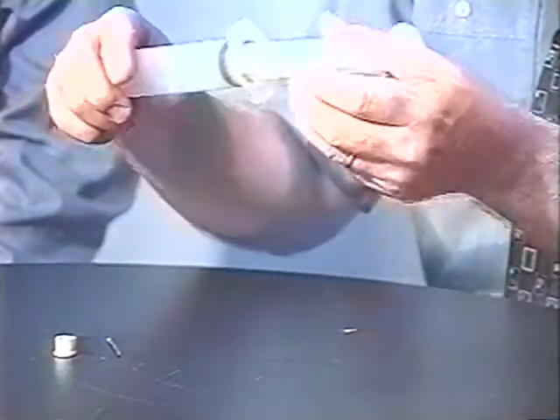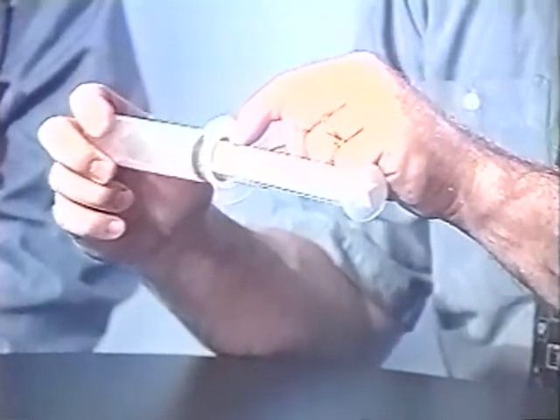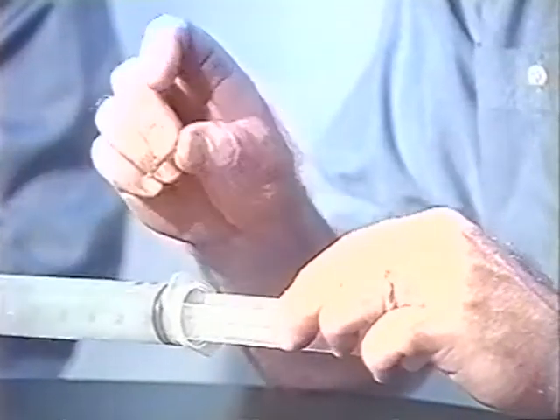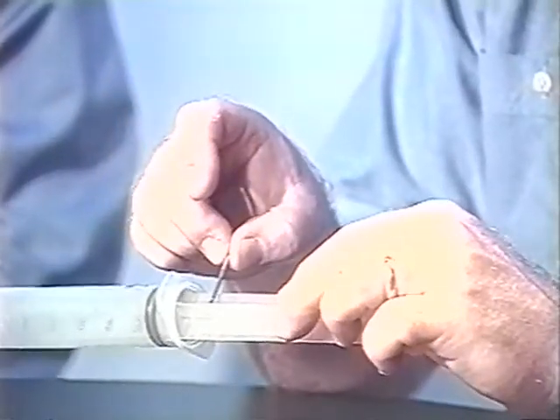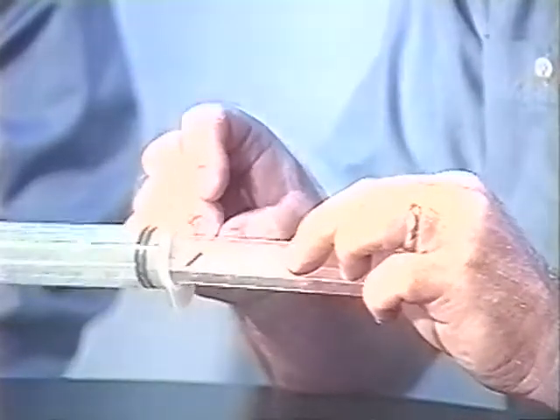Large syringes can also be used to determine the molar mass of gases generated. In order to do that, we have specially adapted a syringe by boring a small hole through the plunger. This was done by heating a nail in a flame until it was pretty hot and then just pushing it through the plunger — it melts right through. This nail is later used in the technique.